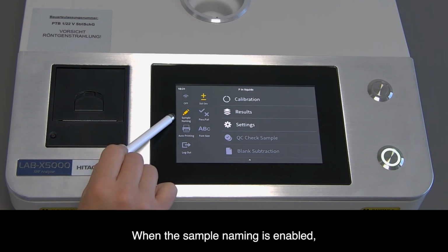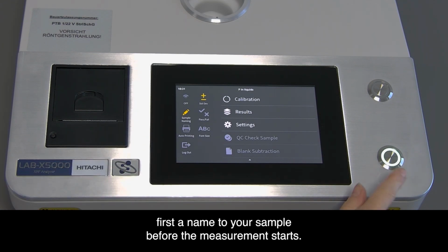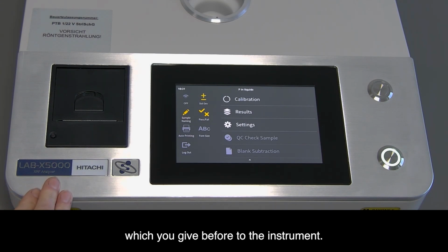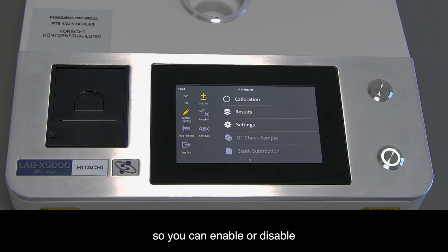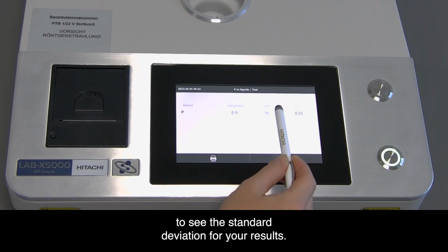When the sample naming is enabled, you have to give, after pressing the Start button, first a name to your sample before the measurement starts. The Pass-Fail icon enables or disables a view that the instrument shows you that your results are out of a range which you give before to the instrument. The last icon is the standard deviation. So you can enable or disable to see the standard deviation for your results.